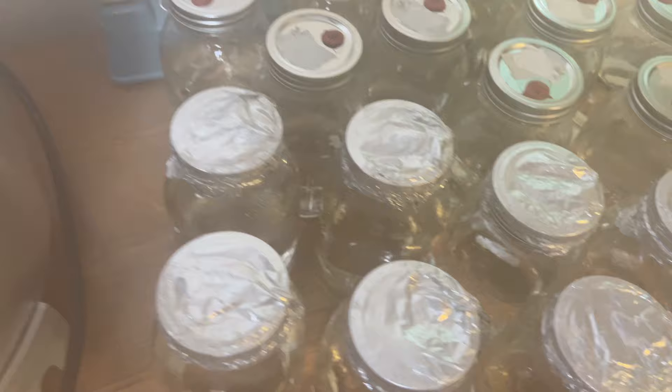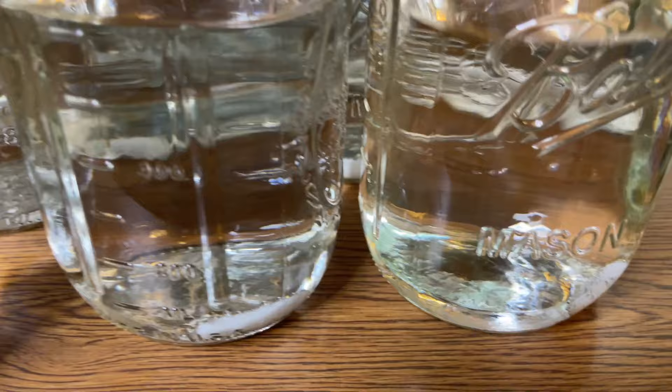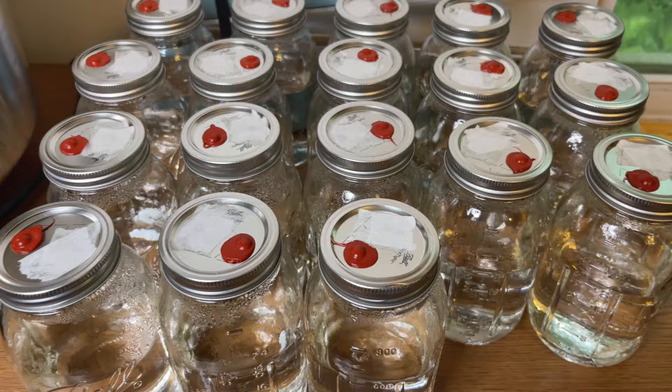After the sterilization cycle is over, you can remove the jar, tighten the lid, and allow it to cool down overnight. The jar should look clear like water without sediment or cloudiness.